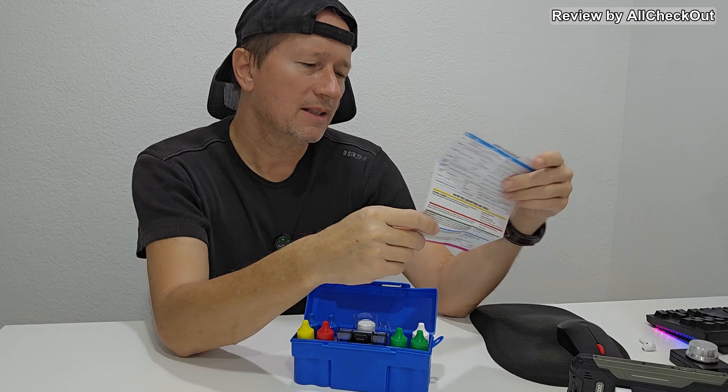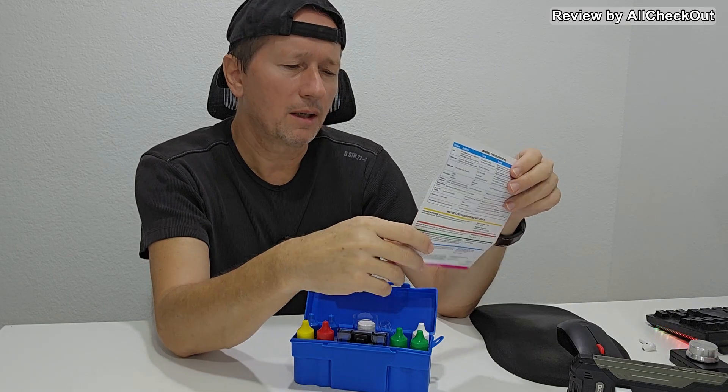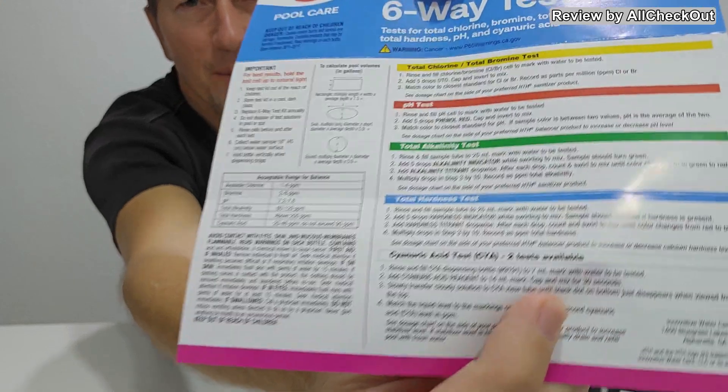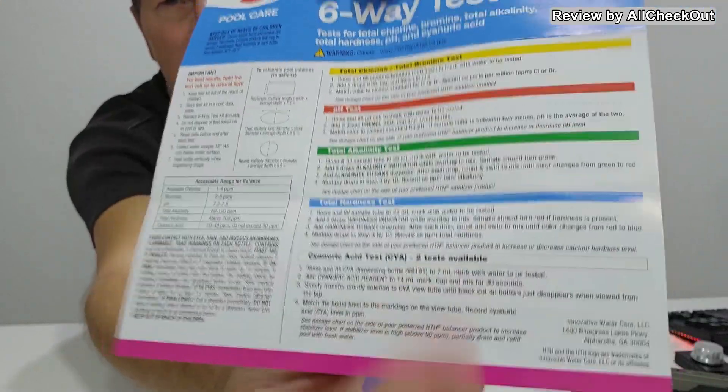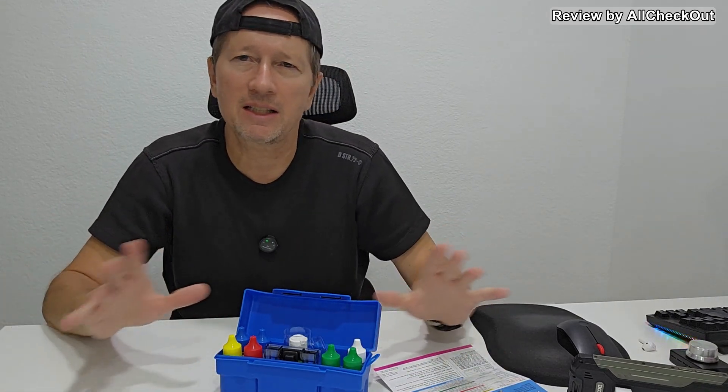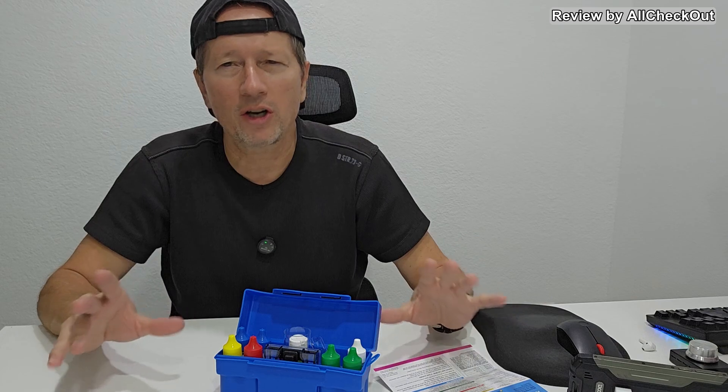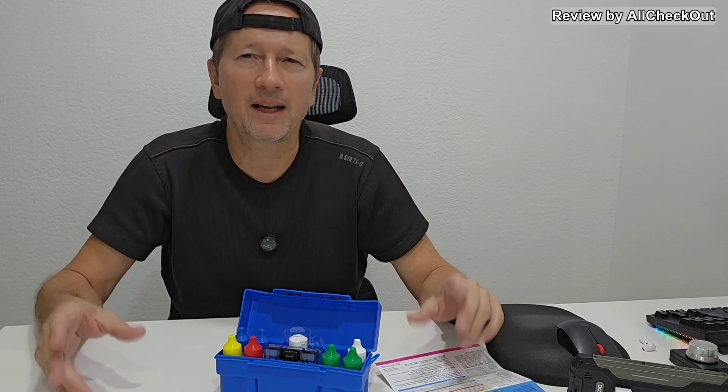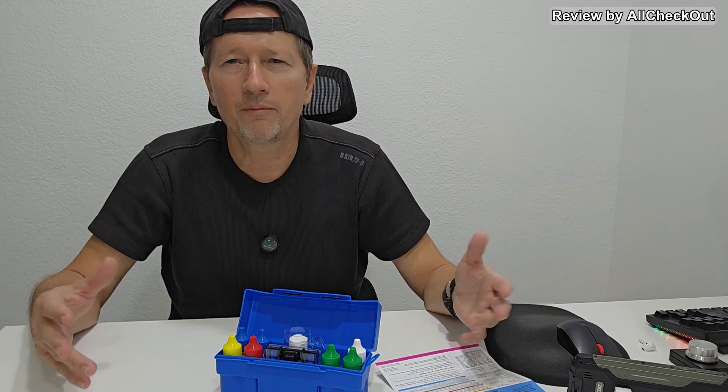But not for the cyanuric acid test, because this test has only two tests available. I mean, of course this somehow makes sense when everything is okay - you just need to adjust it a little bit. We usually don't have to test cyanuric acid every week.